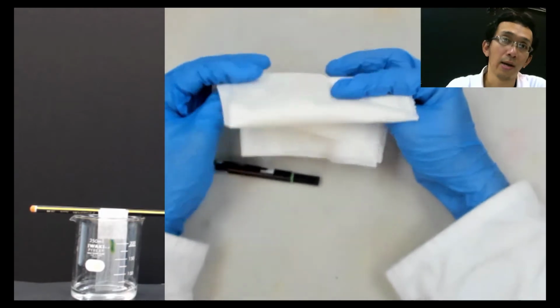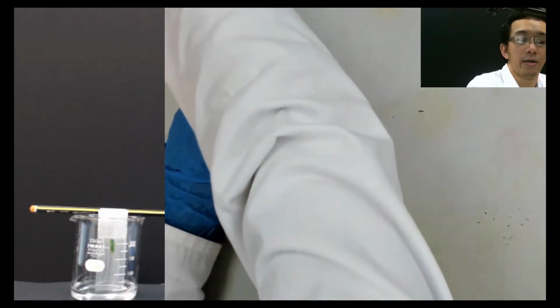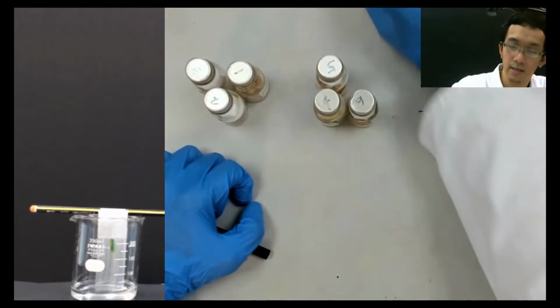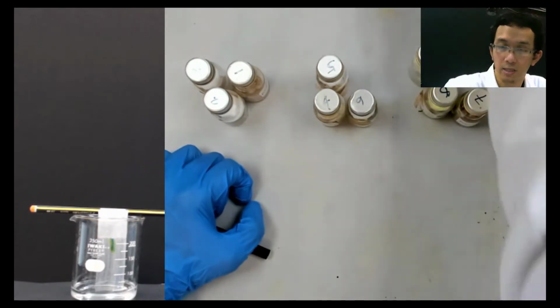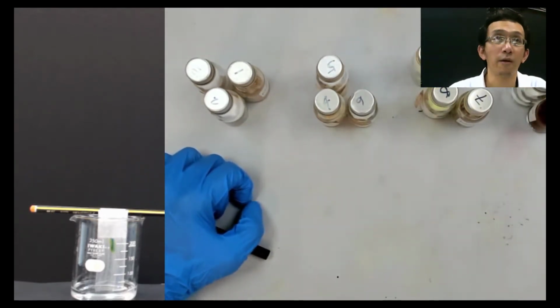But for now, let's talk about what we will do today. The idea of today is that you have this 1, 2, 3, 6, and then 12. Okay, you have 12.